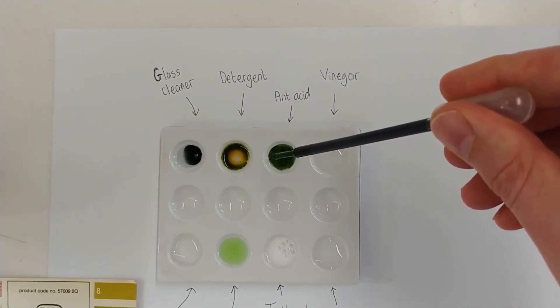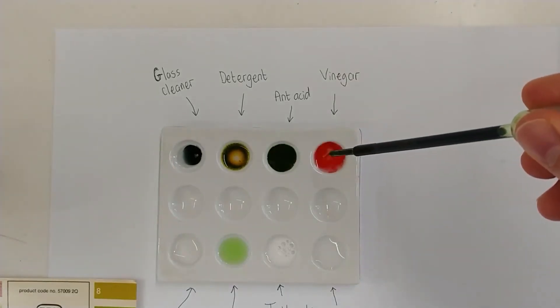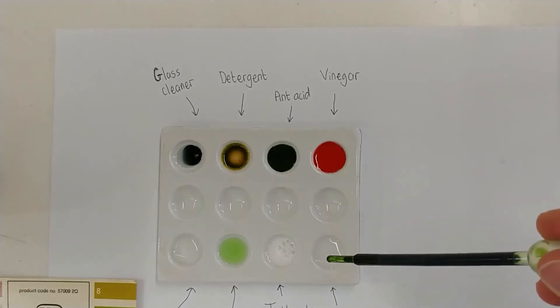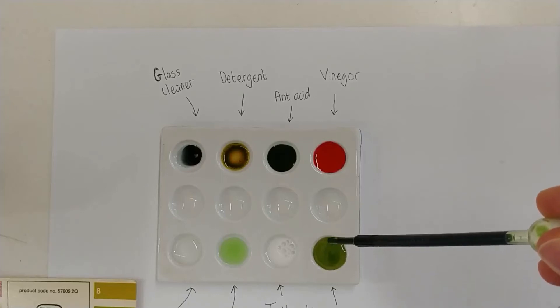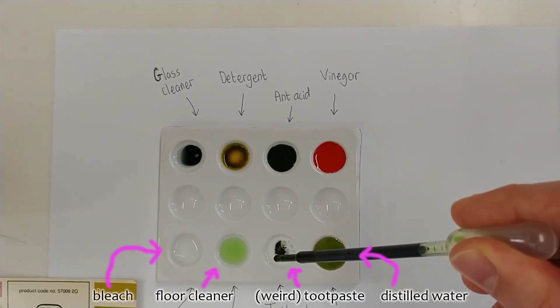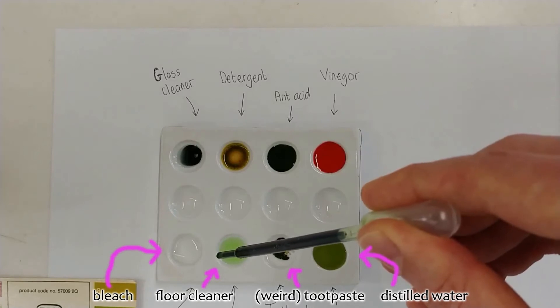Into the antacid. Ooh, that one spread out quite a lot. Now the vinegar. Oh, looks like blood. Thank you for not lining up the video very well, Mr. Archer.